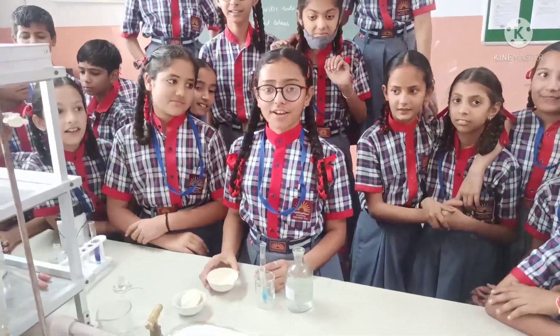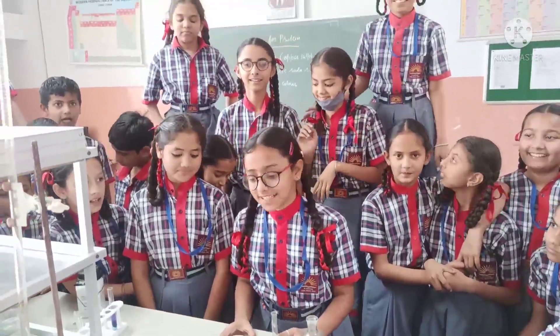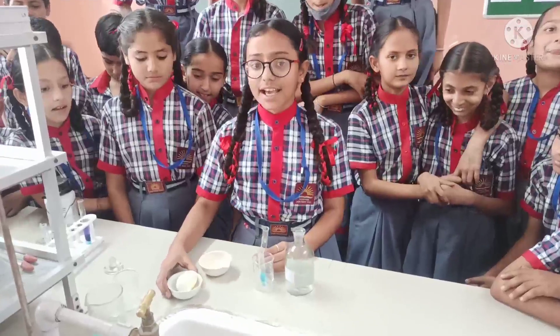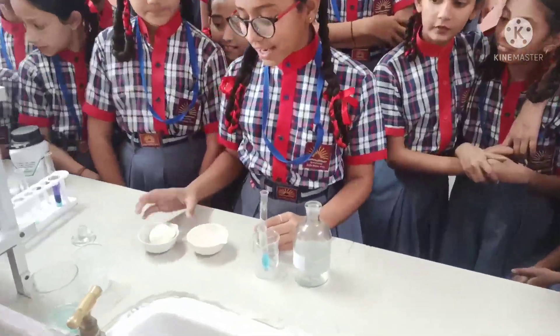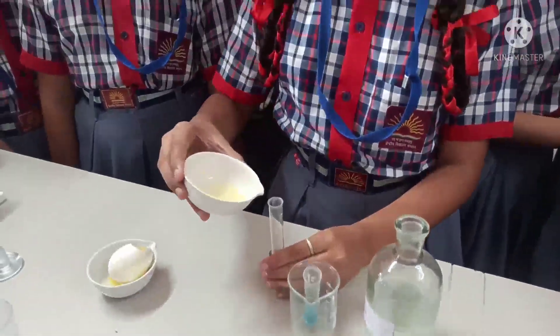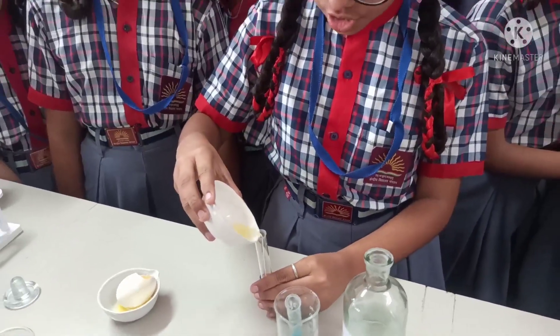Hey friends, today we are going to do a test for protein. As we all know that the egg contains protein, so we are taking the colorless portion of an egg in the test tube.